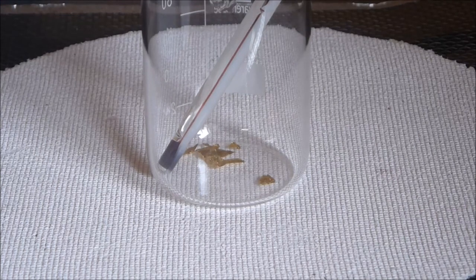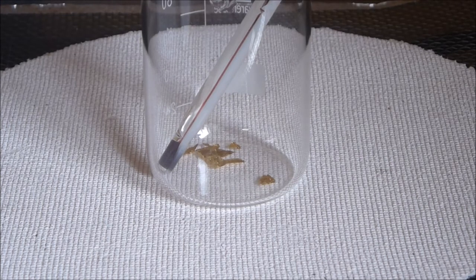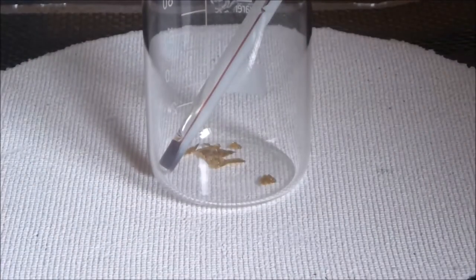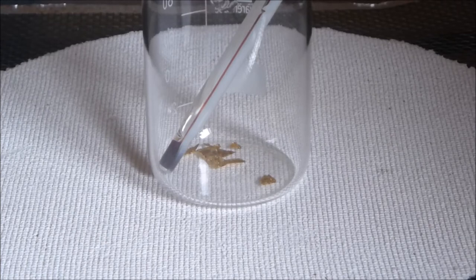Okay, so there we have the little bit of gold leaf in the beaker there. We're going to add a small amount of hydrochloric acid, as little as I can get away with.